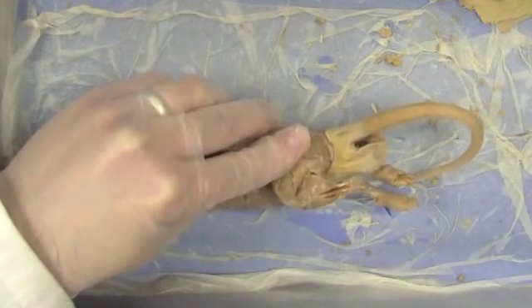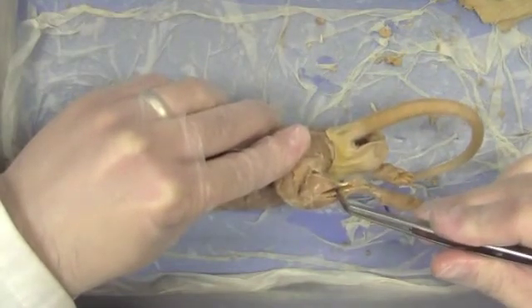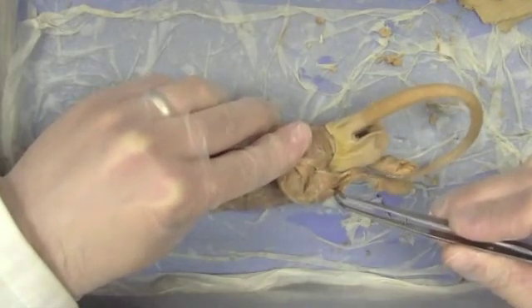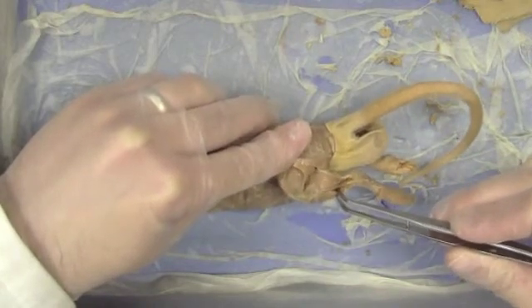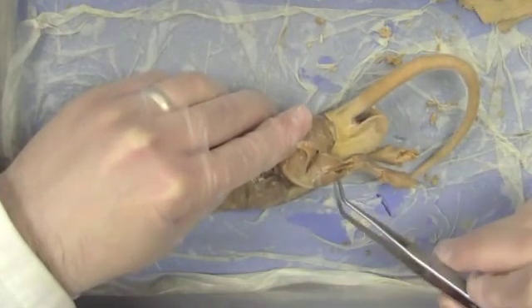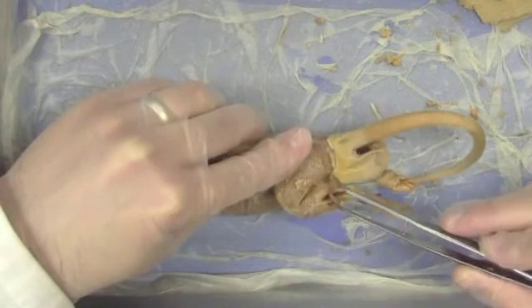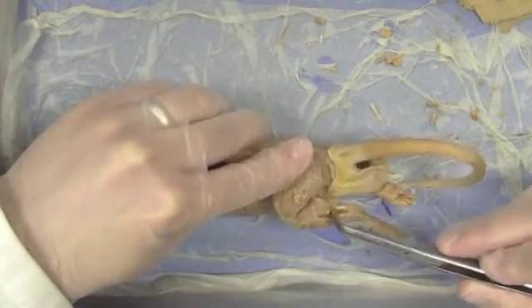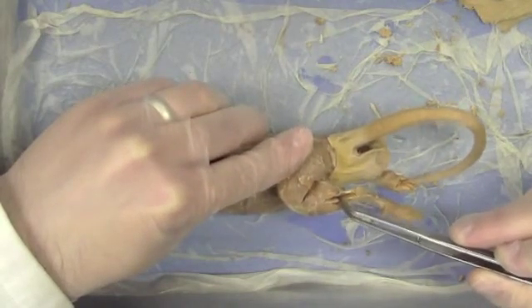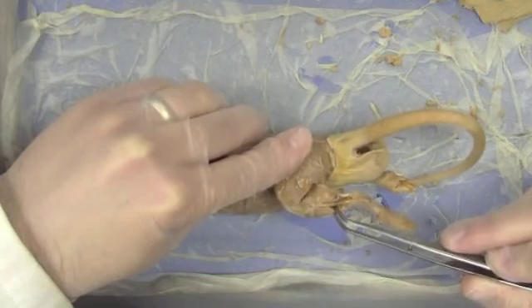Running down the outside of this leg is a muscle called the extensor digitorum — specifically the extensor digitorum longus. On the front of that leg is the tibialis cranialis. This is a good example of how naming on the rat and on the human differs: on us this would be called the tibialis anterior because it's on the front of the body, but on the rat, since it walks on all fours and this is closer to his head, we call it the tibialis cranialis. So: gastrocnemius, soleus, extensor digitorum longus, and tibialis cranialis.